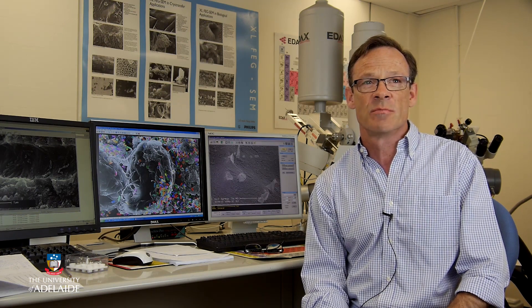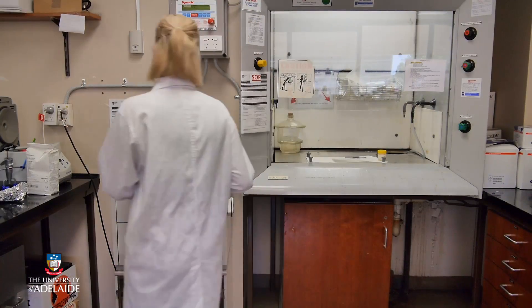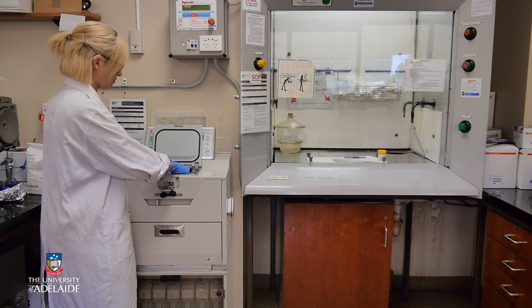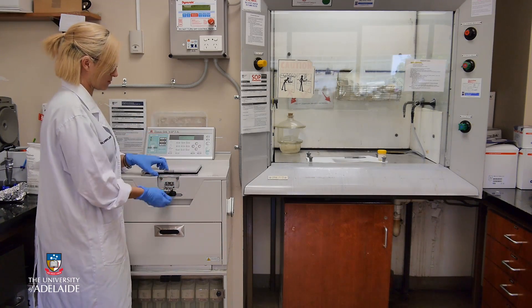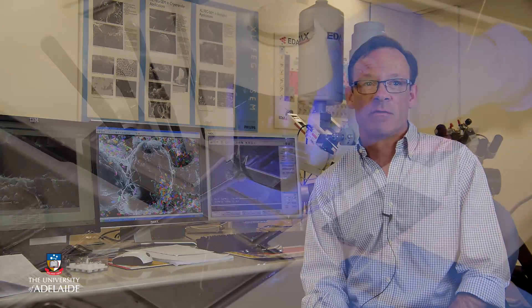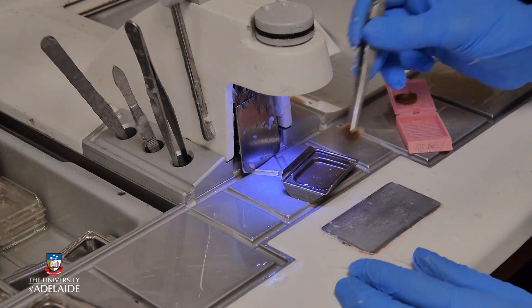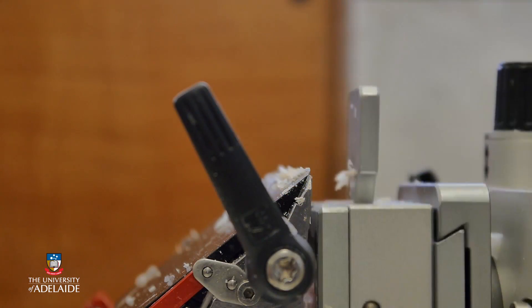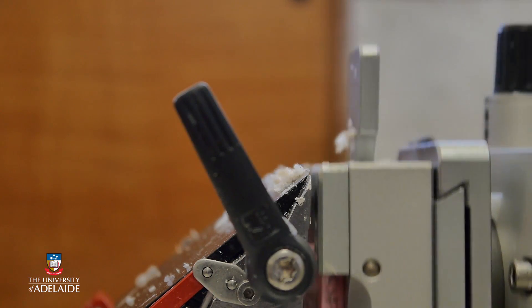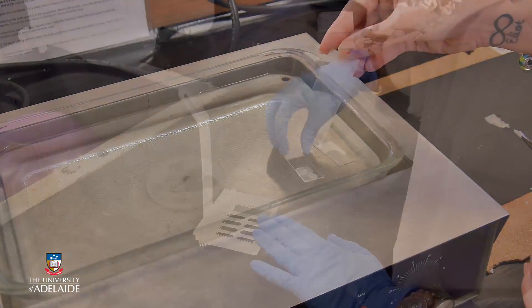Think of microscopes as really powerful reading glasses. Preparing tissue for microscopy varies depending on which type of microscope is being used. However, most tissue preparation is a three-step process. First, tissue is preserved to stop it deteriorating. Second, tissue is cut into thin slices to make it easier to see inside the cells. And third, tissue is stained so that its components can be viewed.